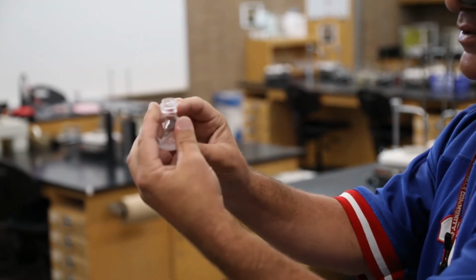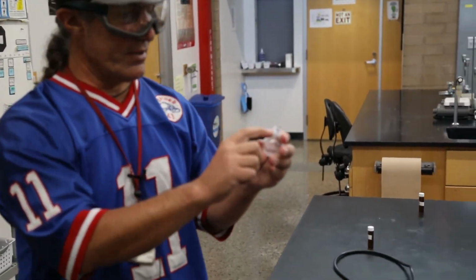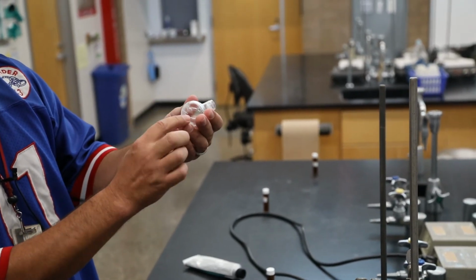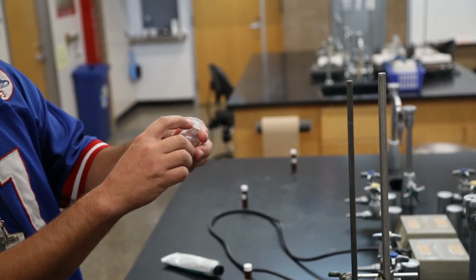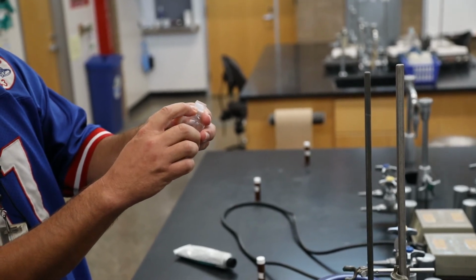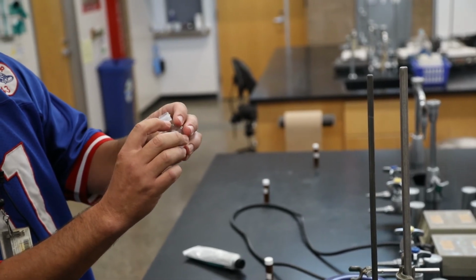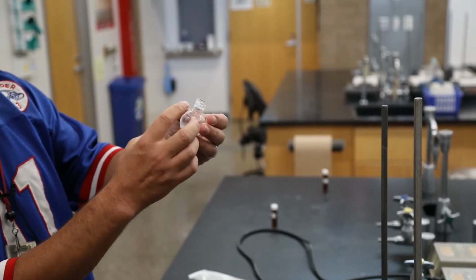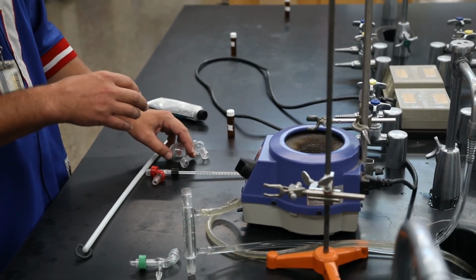For whatever reason, there is a little bit of solid, and I think that might be the silicone grease. And that's why I wanted to use a minimum amount of silicone grease, because sometimes it will rinse down and contaminate things. So I think this flask now has a little silicone grease in it. You can see here where it was, when the grease is on there, it's not so cloudy. So over here, the grease did not wash away. Over here, it did. So that's something to pay attention to. Whenever you see something that's a little off color or a little different, think about what the changes might have been. And so silicone grease looks like it gets rinsed a little bit by the hexane.